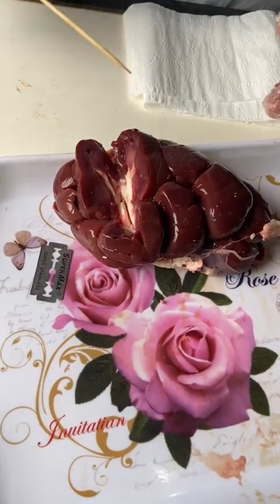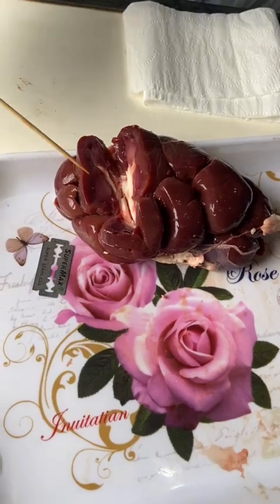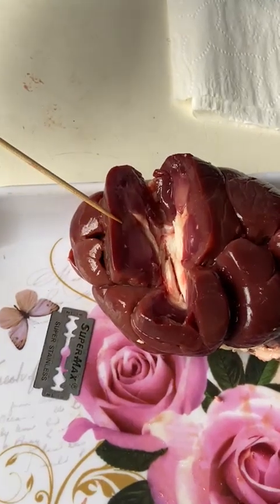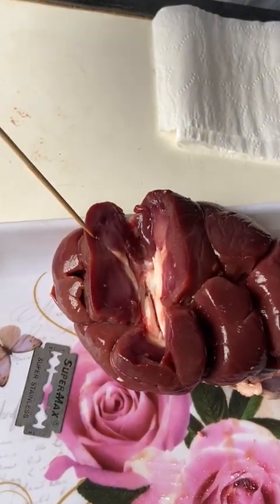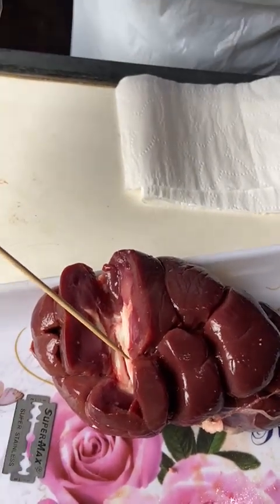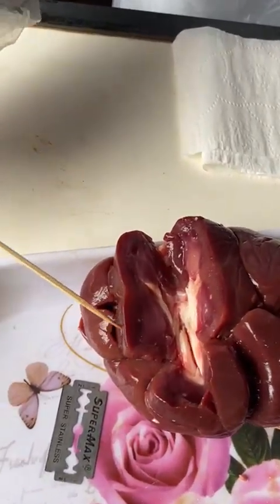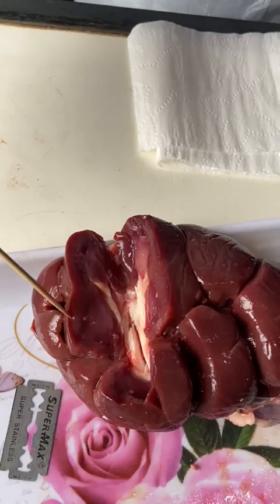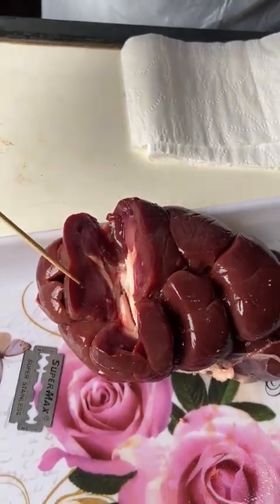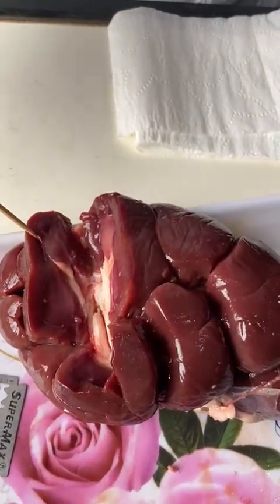Now I am going to observe these internal structures. The first internal structure that I am observing is the renal cortex. This area here is the renal cortex. This region is the outer region just underneath the capsule. Outside here is the capsule, and here is the outer region just underneath the capsule. It contains nephrons that filter blood to remove waste.